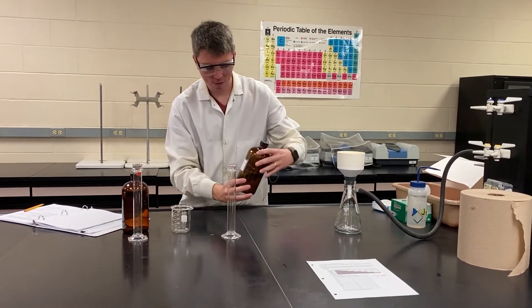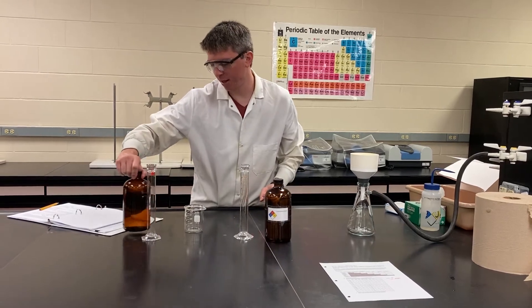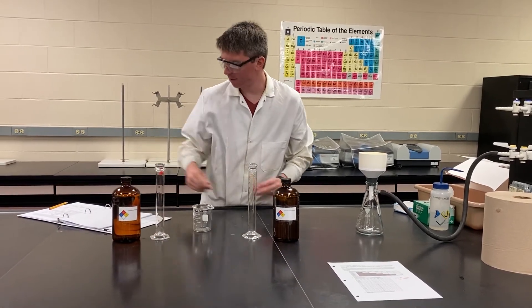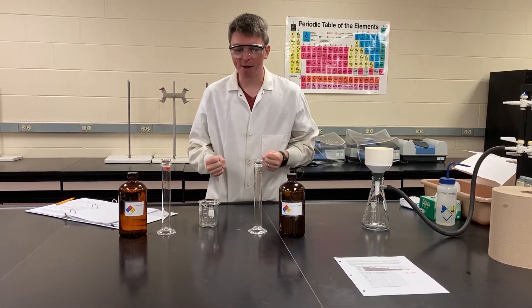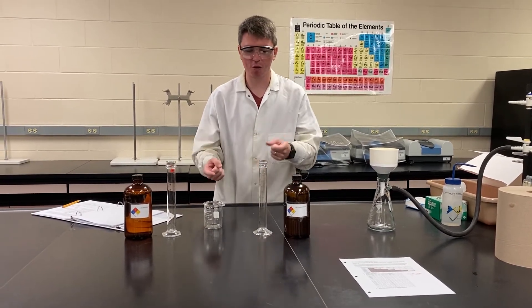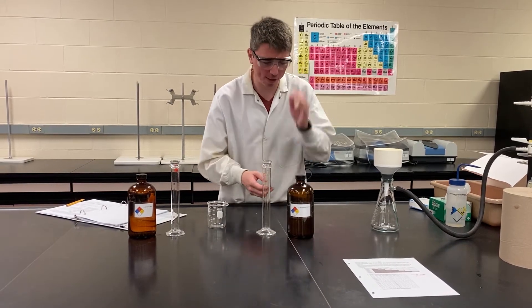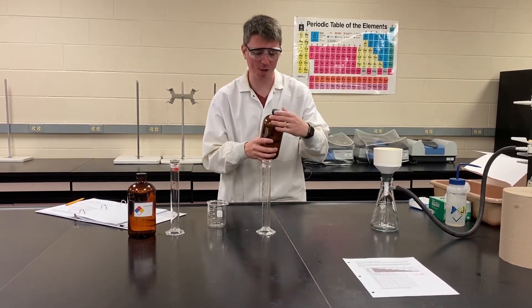What we're going to be doing is mixing potassium chloride and silver nitrate — the chemicals we used for our precipitation experiment. Very, very important: use different glassware for each chemical. If you start trying to measure them out in the same graduated cylinder, you'll get the reaction in your graduated cylinder, which will drastically mess up your volumes.